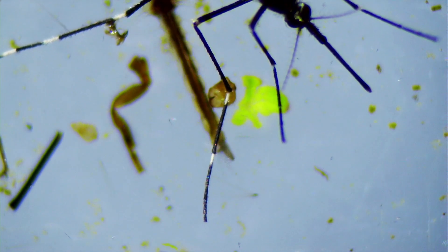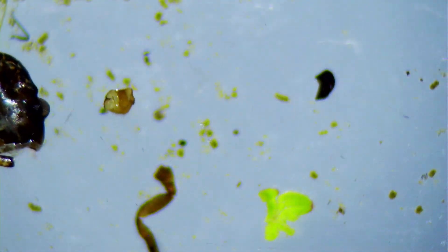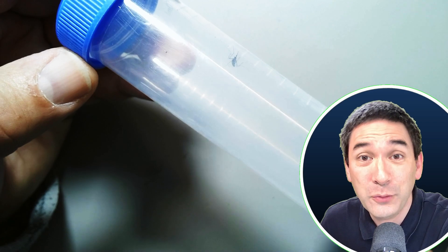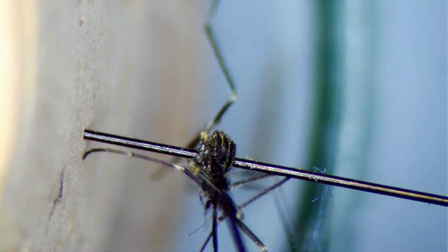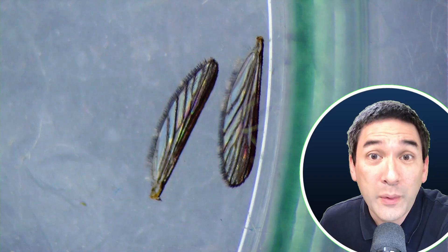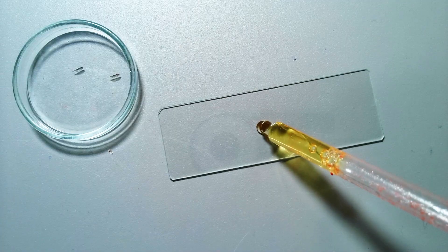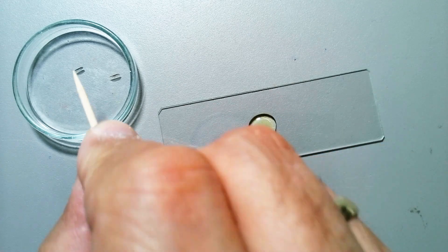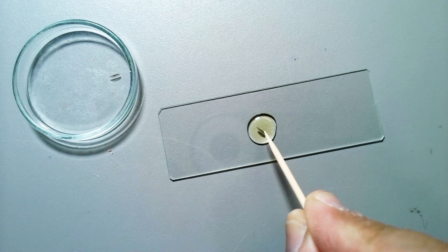I would like to encourage you to write comments in the comment section if you know what species it is. It was sitting on the surface of the water and flew away, and I was able to catch it again in a tube. After approximately one day it died in the tube — it didn't find any food to eat — and therefore I decided to pin it up and put the wings under the microscope. Scissors would have been too large to remove the wings, so I used tiny insect needles to remove the wings. Then I made a permanently mounted microscope slide using those wings, adding a little bit of mounting medium on the slide and transferring the wings into the mounting medium one by one using a toothpick covered with a sticky mounting medium.